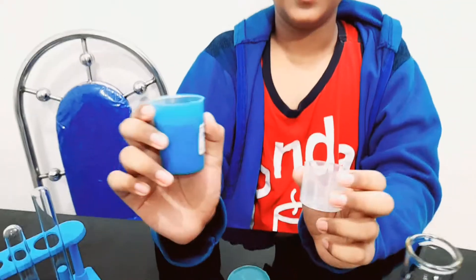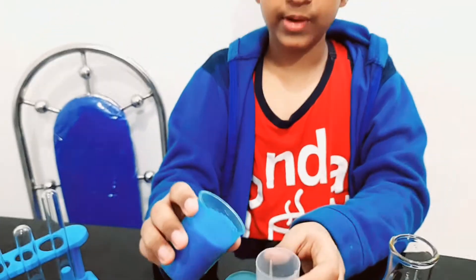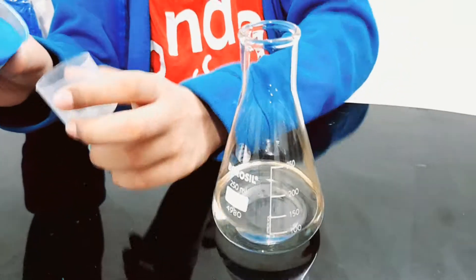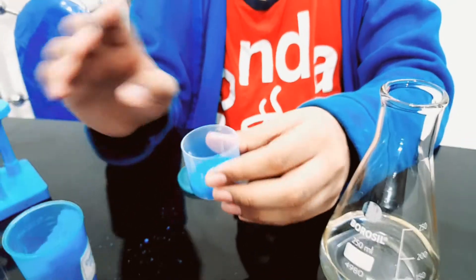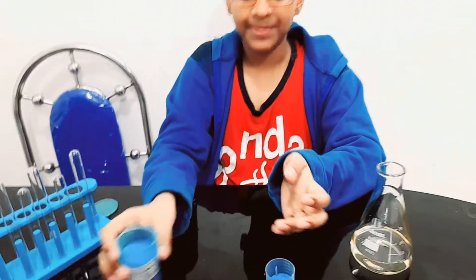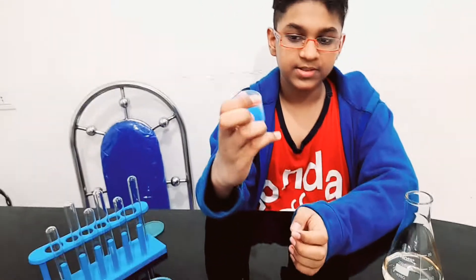First of all, in a measuring cup I should take exactly 16 grams, as I'm having 100ml of water right here. To take 16 grams I've got to dump a bit. Just look at the blue crystals — it's so beautiful, I just want to play with it, but it's not very good to do that. So I took about 16 grams in this measuring cup.